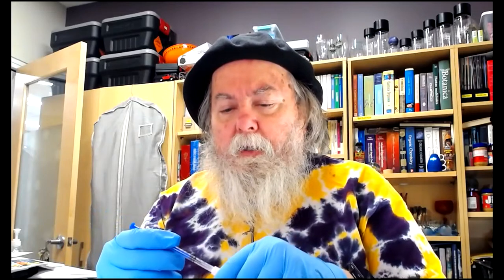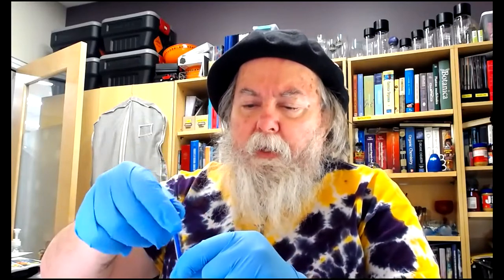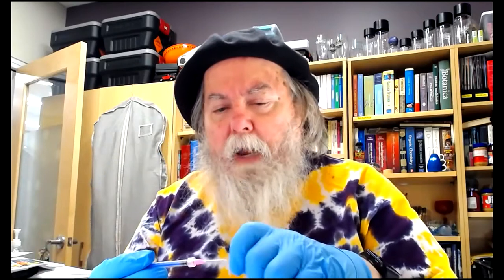We're also going to use syringes. You're going to measure out 4/10 of a mil of alcohol. This is a 1 mil syringe. I want you to pull this up to about 1/2 mil. Then point the needle, be careful, those are sharp, back into the flask and push down to about 4/10 of a mil. Then cap the needle. Or no, you're not going to cap the needle. You're actually going to put this into your reaction vial. Measure it into the reaction vial. Then cap your needle and put this back for the next person to use.